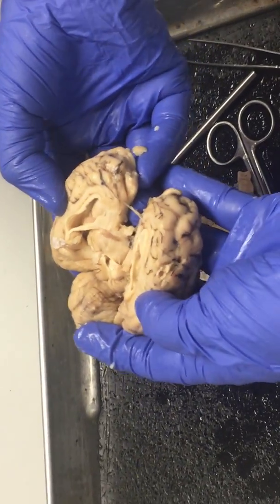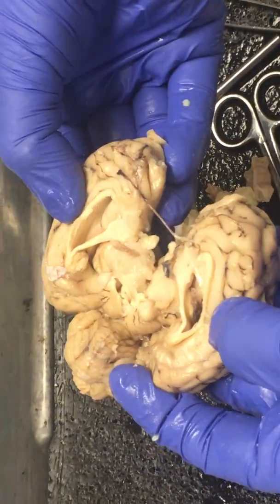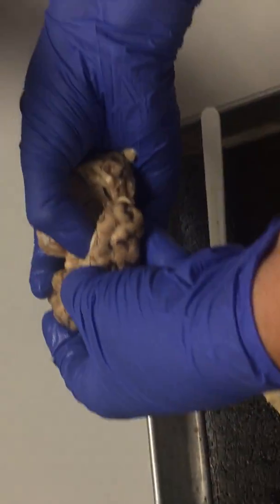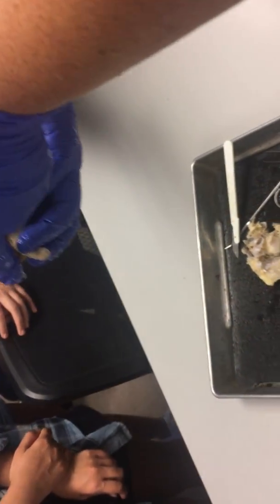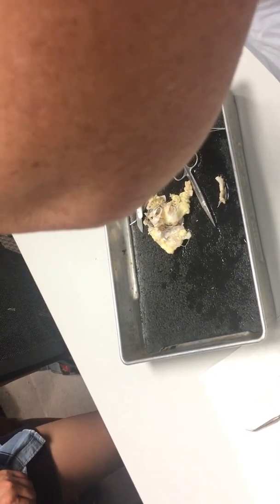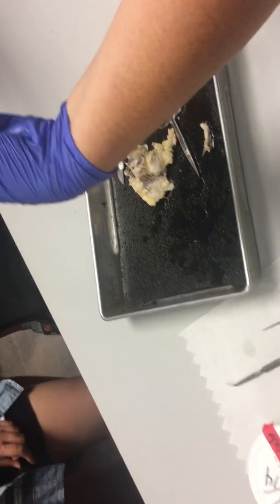What I did was — remarkably — there's a little septum dividing the ventricles, and I cut through it. So these holes right here — those are ventricles. You can actually see into the ventricles on both sides. See that black stuff right there? That is the choroid plexus. And what kind of cells is it made of? Those are ependymal cells.